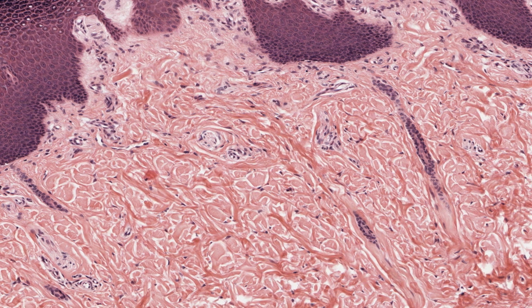Dense connective tissue here is characterized by both the great amount of collagen and by the size of the collagen strands. The collagen in loose connective tissue is mainly in the form of individual fibers, about 1 micrometer in diameter. Dense connective tissue has large bundles of collagen fibers. The denser a connective tissue is, the grosser its bundles of collagen fibers are, as you can see here. It's evident that the bundles of collagenous fibers in the dermis can be massive in size.